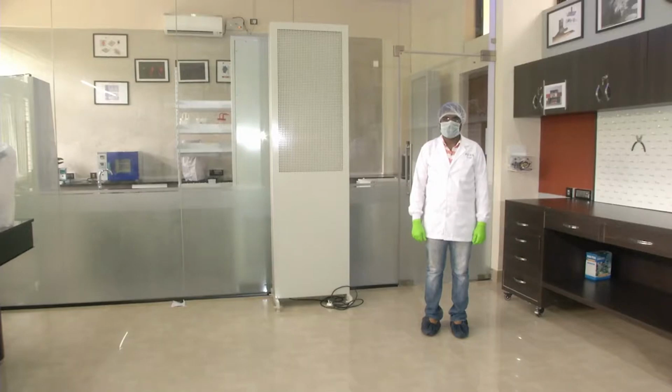Welcome. This is another module where we are introducing the various components of a microfabrication lab.